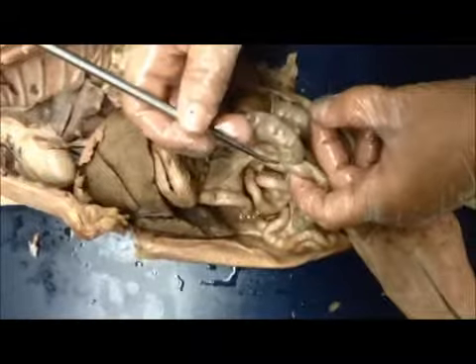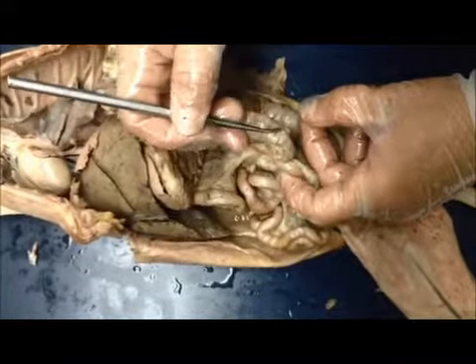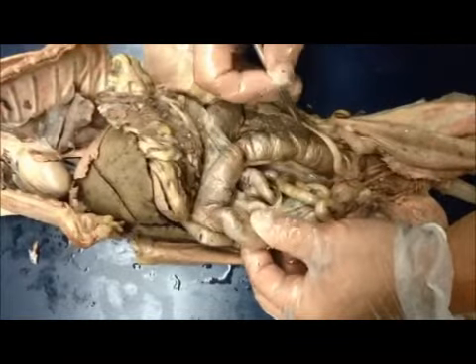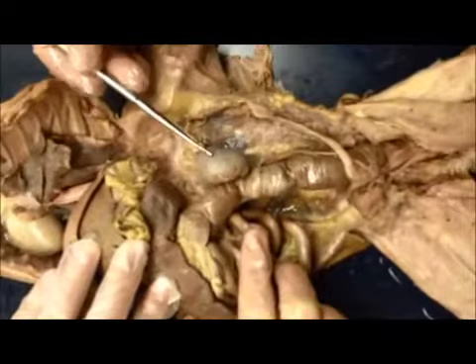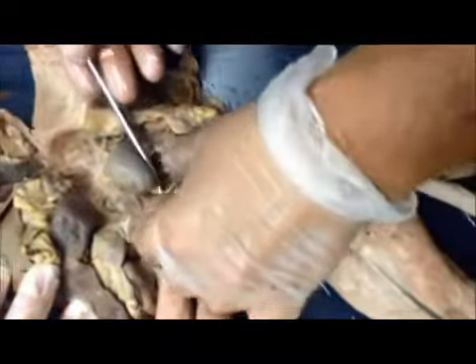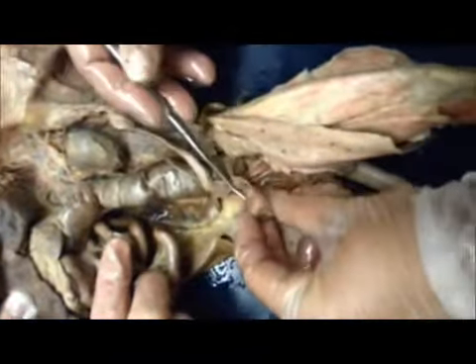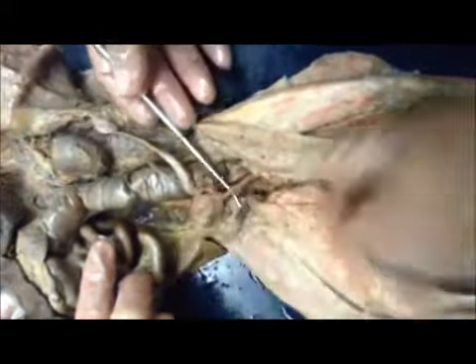The large intestine starts with the ileocecal sphincter connected to the cecum. We have the ascending, transverse, and descending colon, which leads into the rectum. The kidney, above the kidney, the adrenal gland. Below the kidney, connected, is the ureter, which comes down here to the urinary bladder. Below the urinary bladder is the urethra.